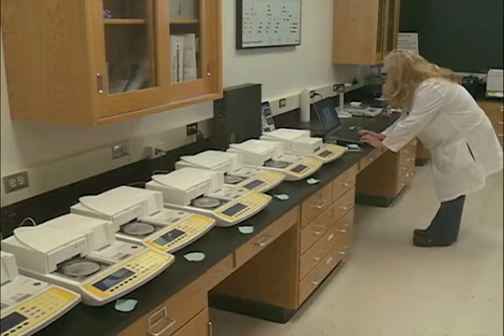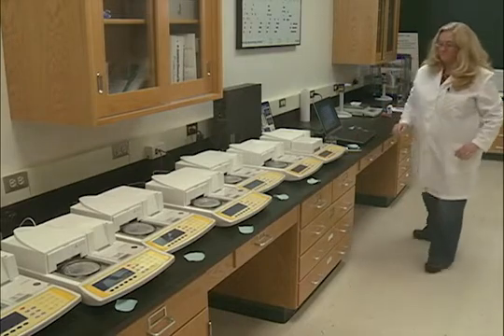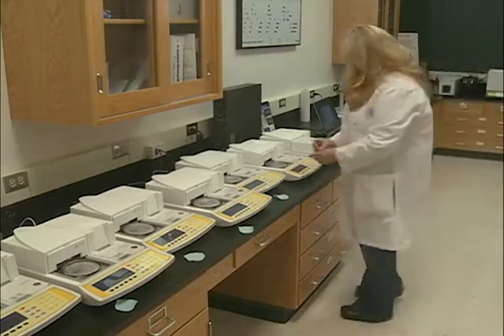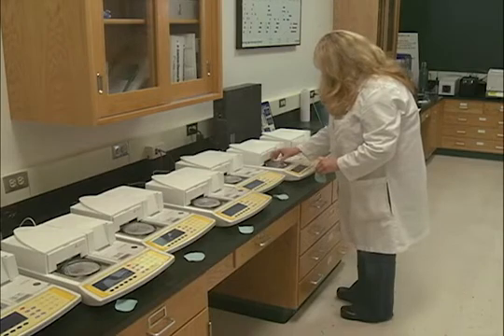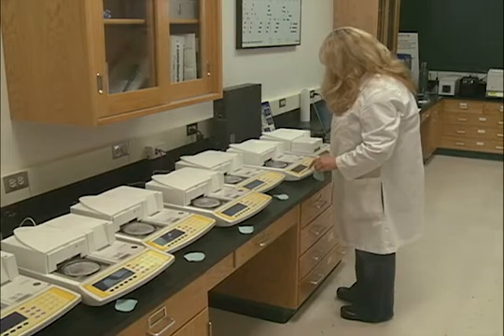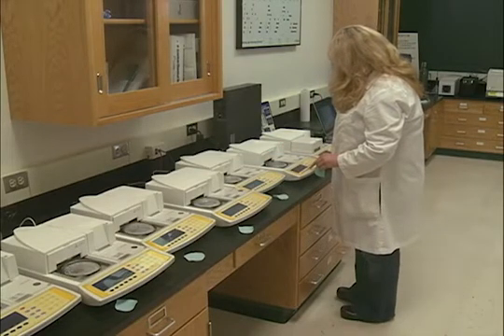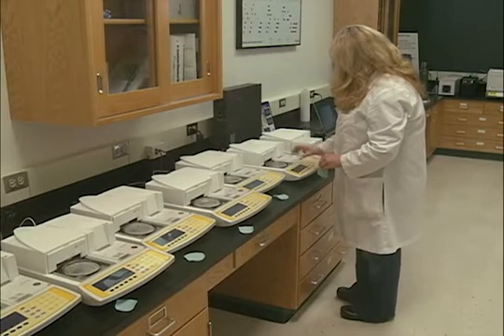The test uses 70-millimeter diameter specimens. The test method entails taring, removing the combined weight of the test instrument support platform and a wire screen, as the zero starting point of the analyzer.